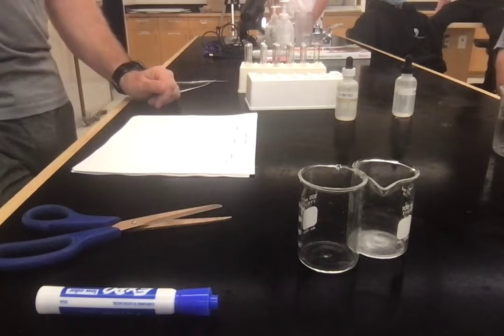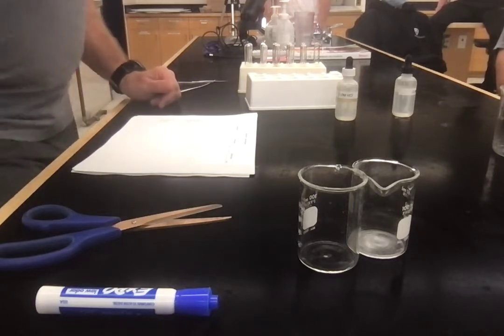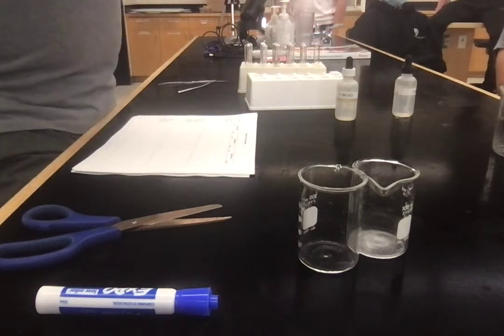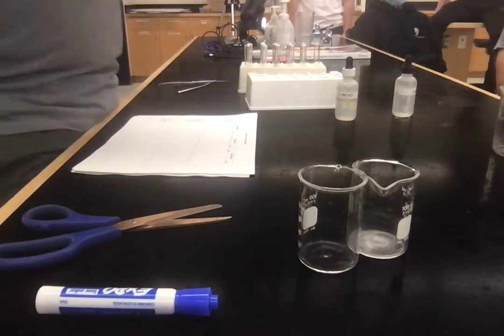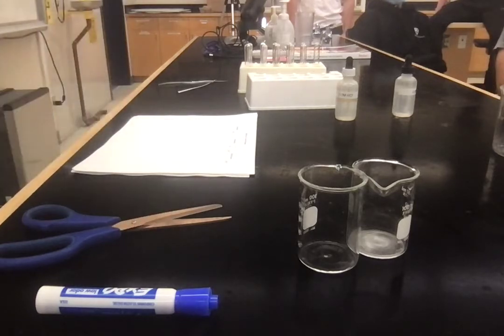Well, what do you see compared to the start? Is there less of the solution? The solution is probably about the same. What about the magnesium? Can you see it in there now? I cannot see it. Okay, so it's kind of gone. So the magnesium disappears over time. The magnesium gets used up.